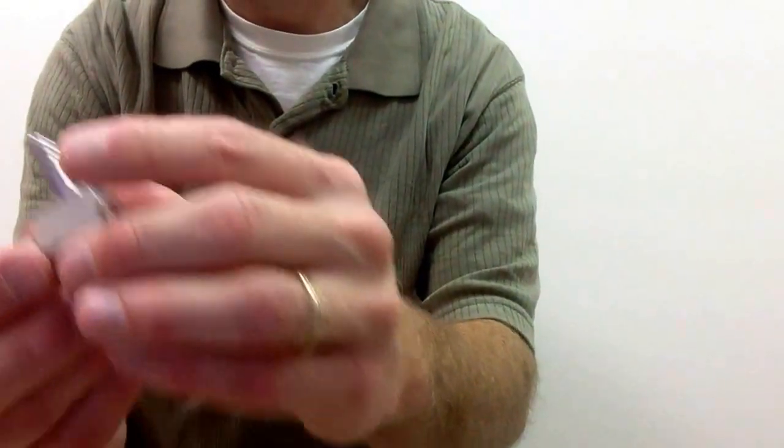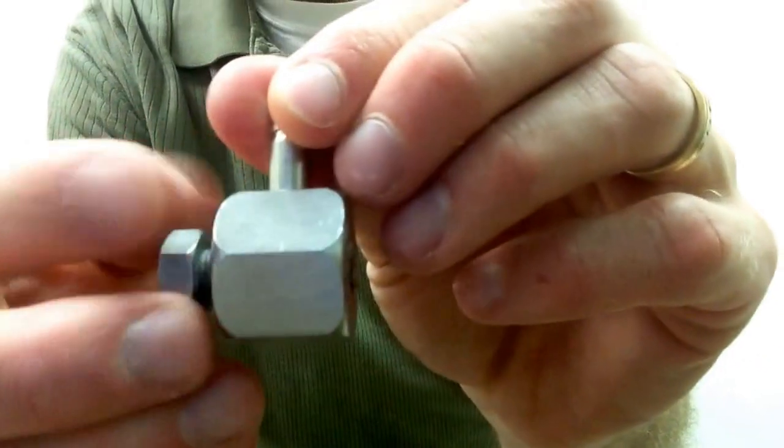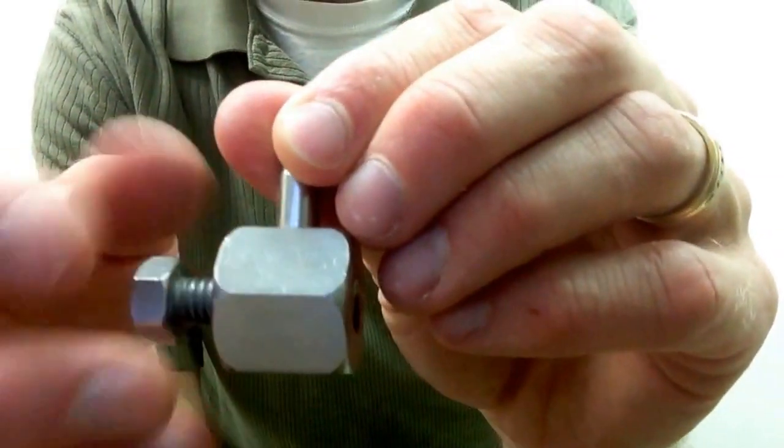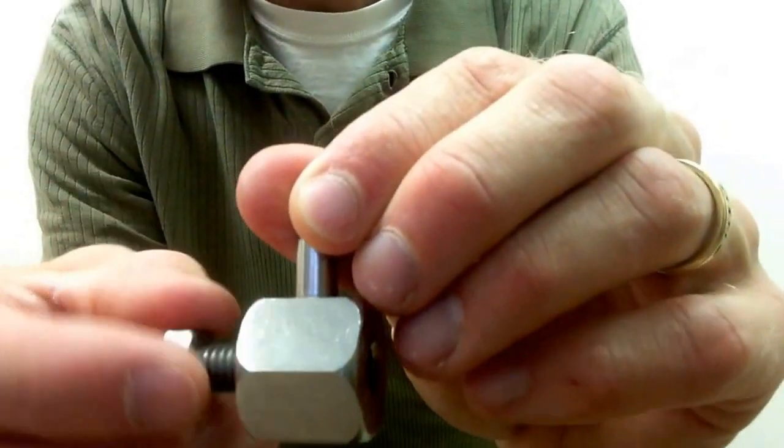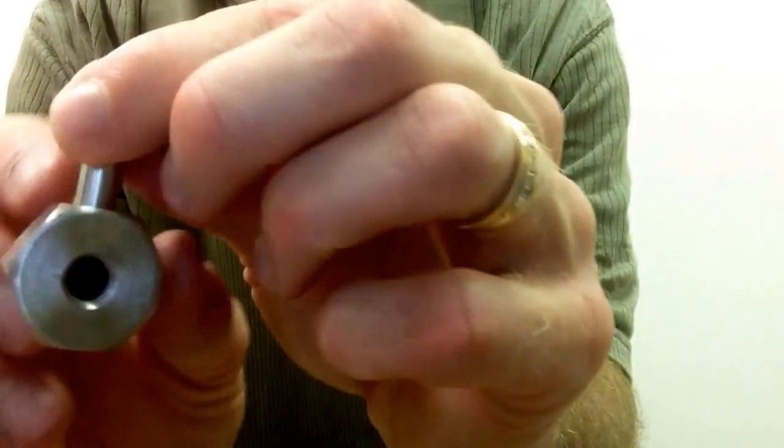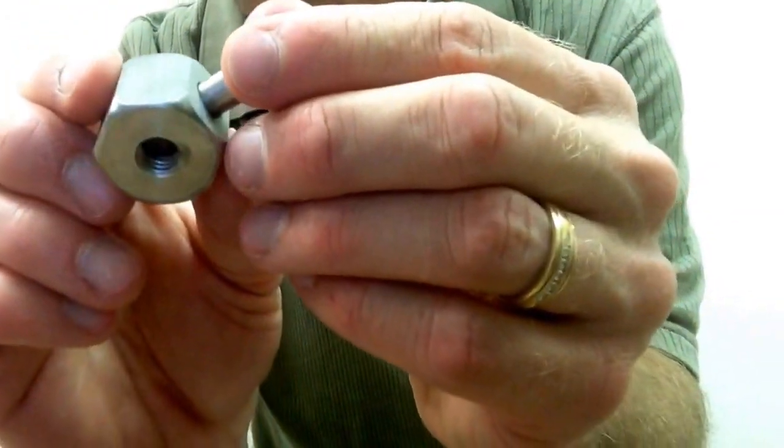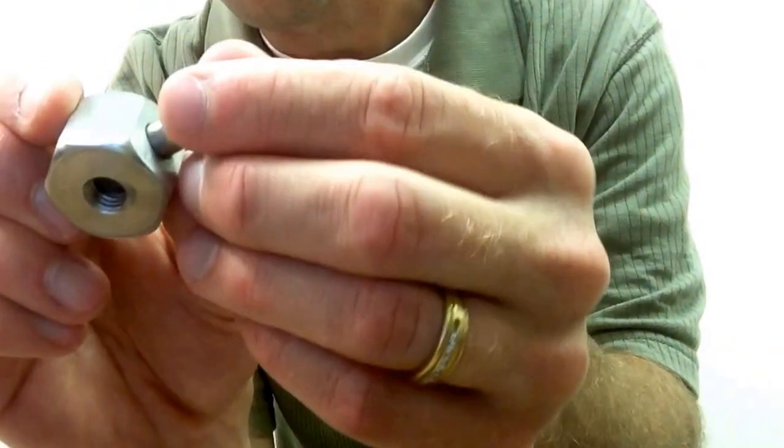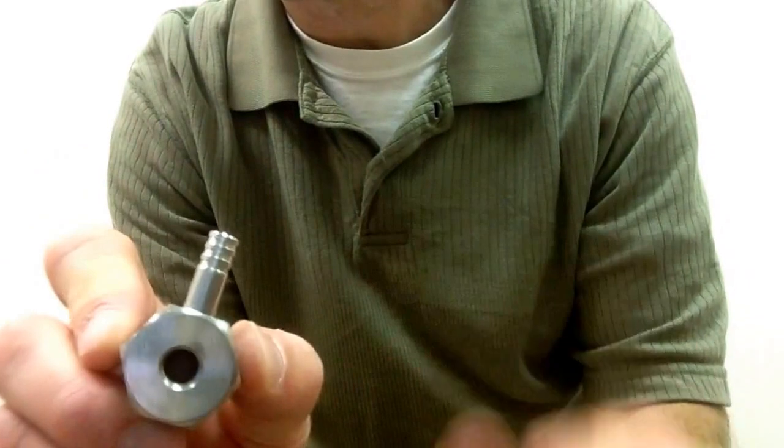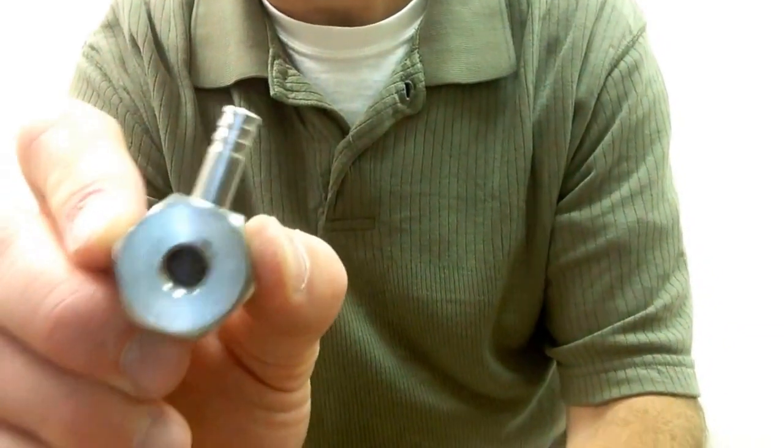Here's the moment of truth. You can see I've unscrewed one and the other. Now I've got it loosened with the wrench. I can hand loosen it, and you should be able to see that we can sort of see through a very thin wafer. It's hard to see on the video, but I'm going to take this now over, and we'll put it in the sample holder and collect our spectrum.